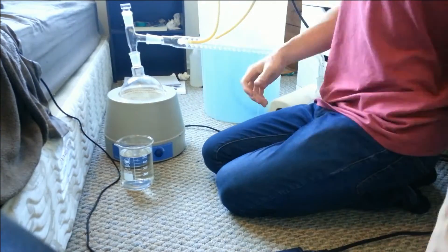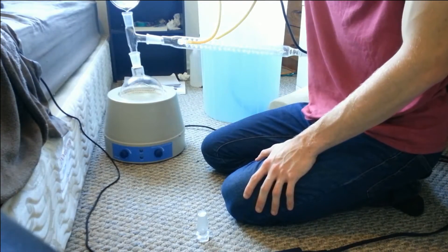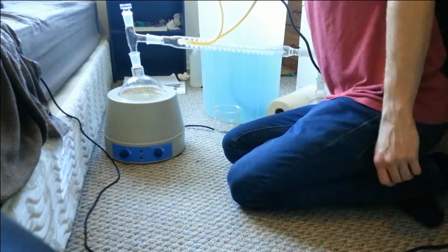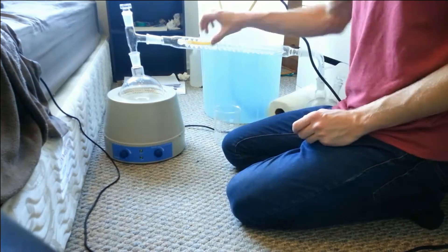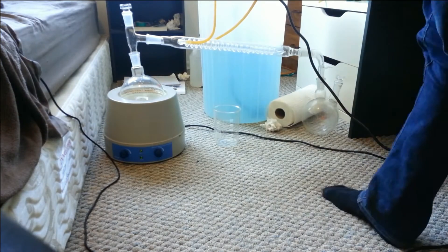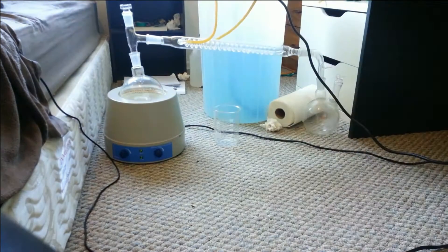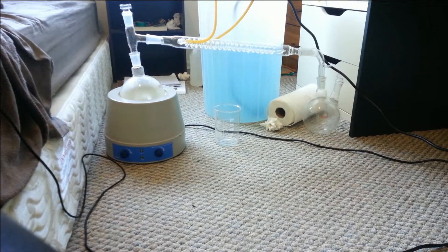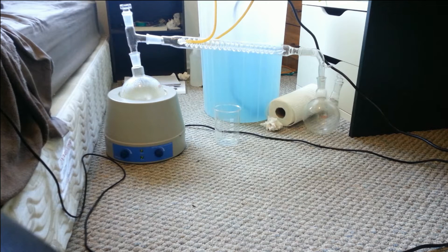Connect your condenser as follows, and then connect your hoses into your coolant bucket. Normally you just use water. Make sure that the coolant is flowing towards the heating mantle rather than away from it. Turn it on and wait for it to start boiling. This could take a while.